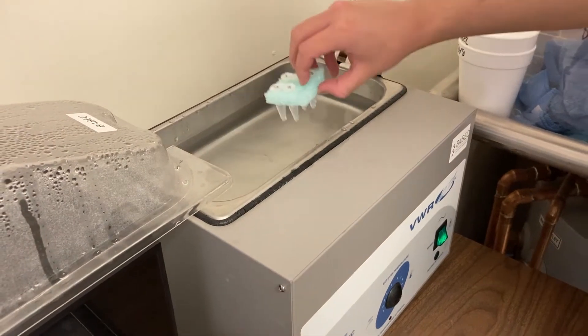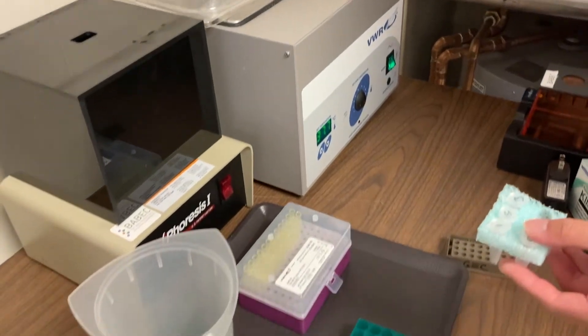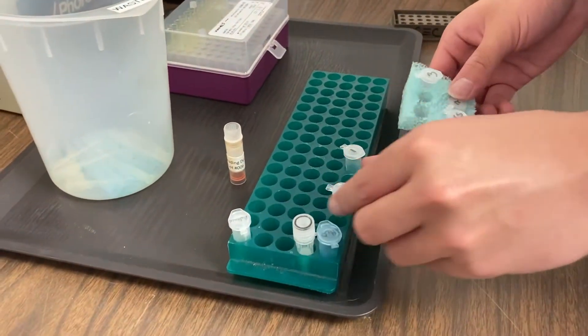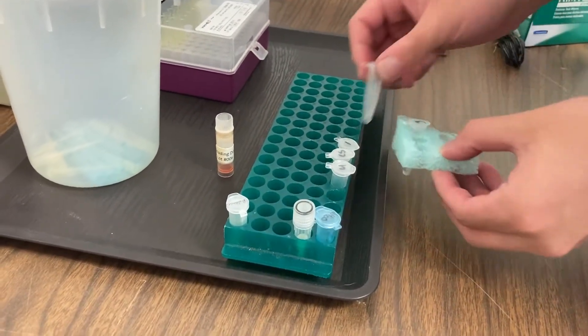Once our restriction digest is over, we want to try and find our DNA fingerprint. So we're going to take our samples out of the water bath after 10 minutes, and we're going to load our samples onto something called an agarose gel.